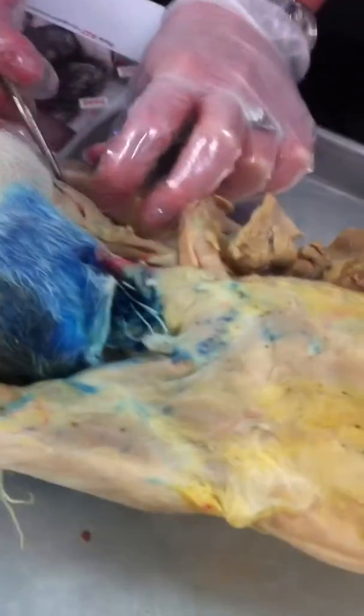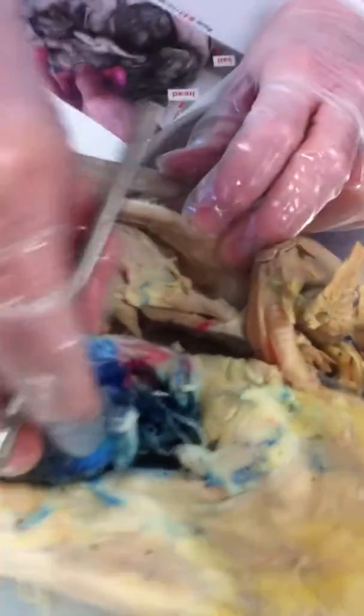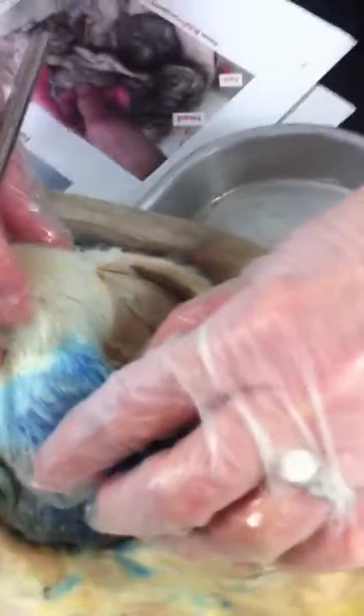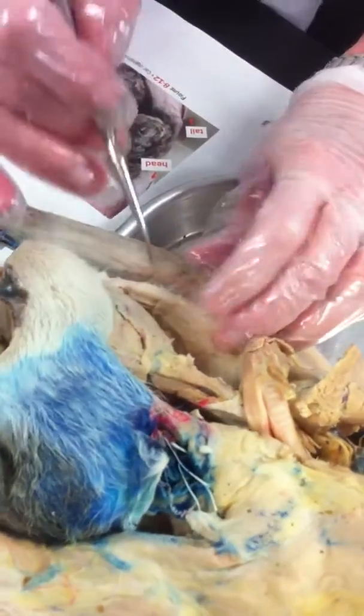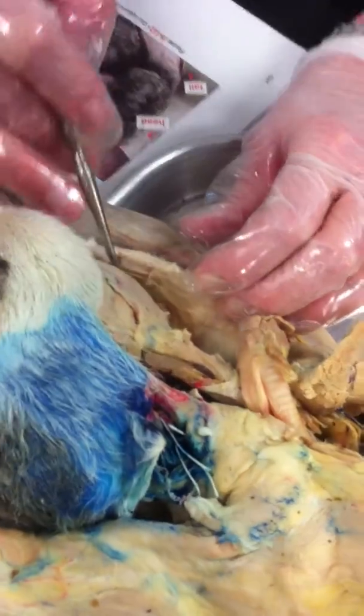I don't know. Why don't you plot a list where I can do it in order? And let me see if this is one where we have rugae of the hard palate. Hard palate. But it does look like that. Okay, the rugae. I'm not seeing the salivary glands show up very well. Is this Miss Ramey's? Yeah. Okay, that'd be why.